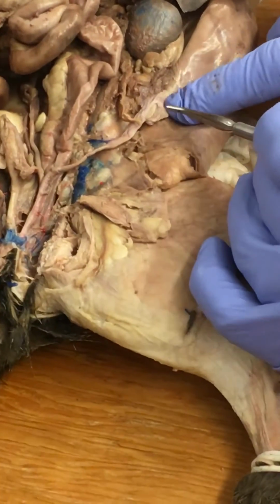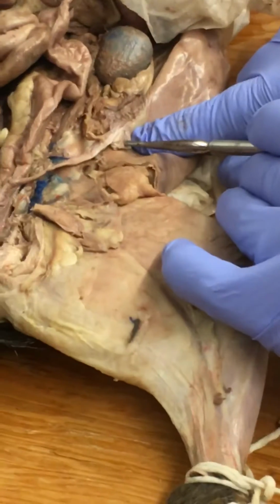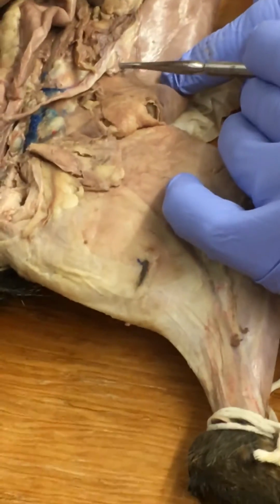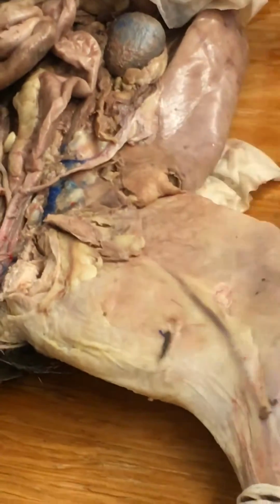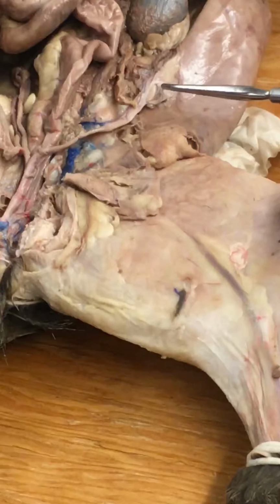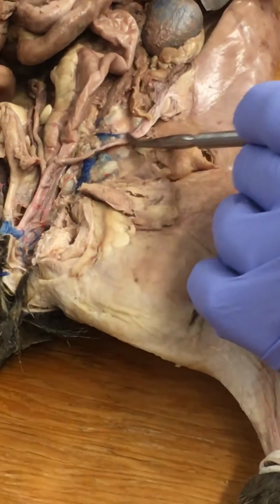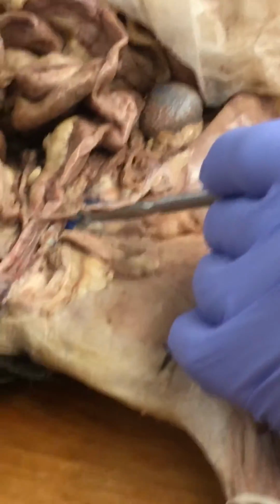Here's the ovary, and this is a hard one to see, but there's a little catcher's mitt, and then there's this little band of tissue, where I put the probe. If you look really closely, it's a super tiny coil of a tube that's coiled over and over on itself, and that is the oviduct. This thing right here that you see is not the oviduct. That's a uterine horn. I want to just go to the board for a second.